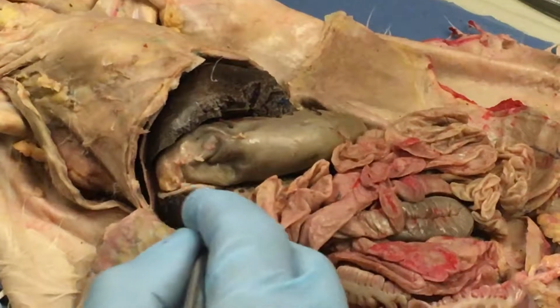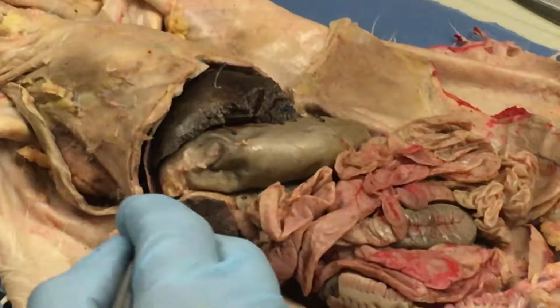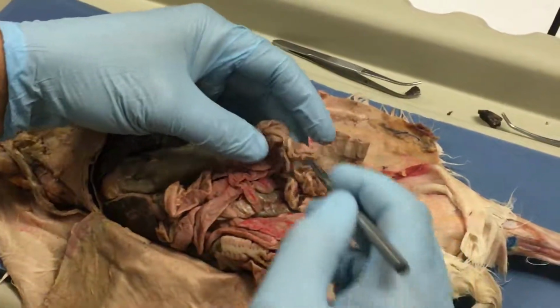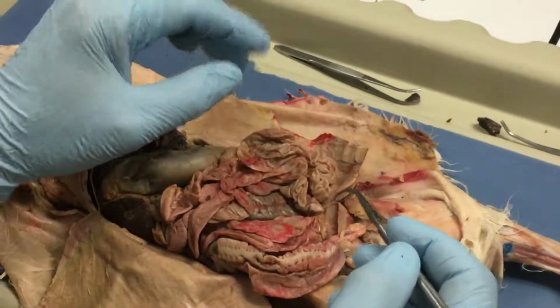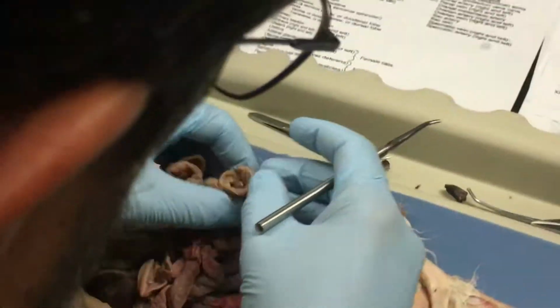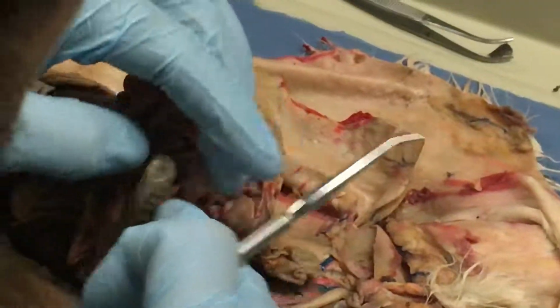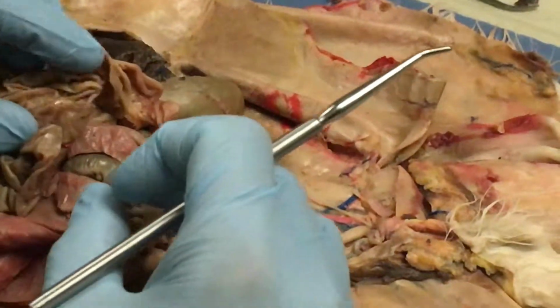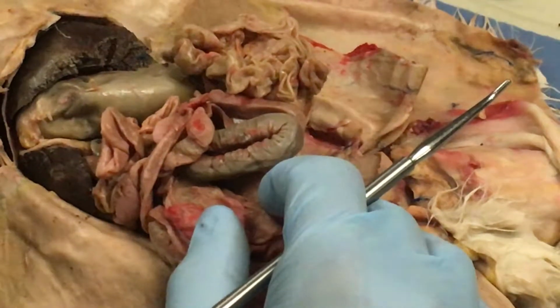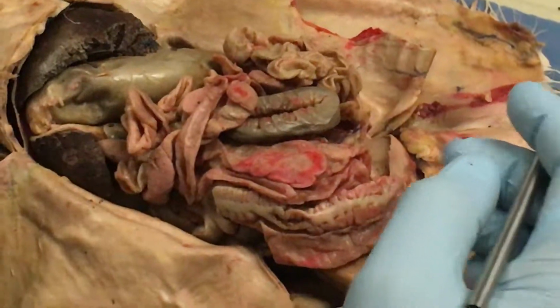We've got the duodenum right here. Okay, and that's just the first part of the small intestine. And if I put a pin anywhere else in the small intestine, it's just going to be small intestine. I'm not going to make you say the first 50% of it is jejunum and the last 50% of it is ileum, and so where does the jejunum end and the ileum start? Who cares? If you can recognize it, that's fine.